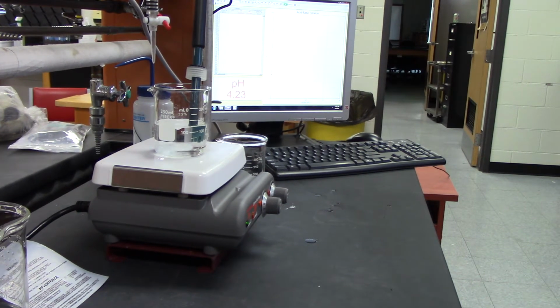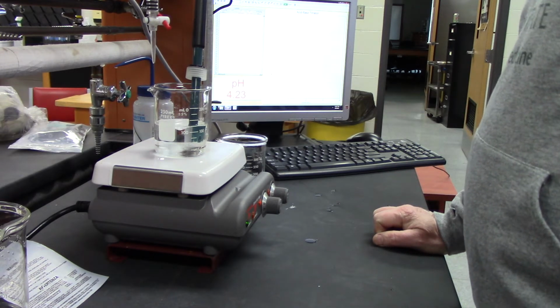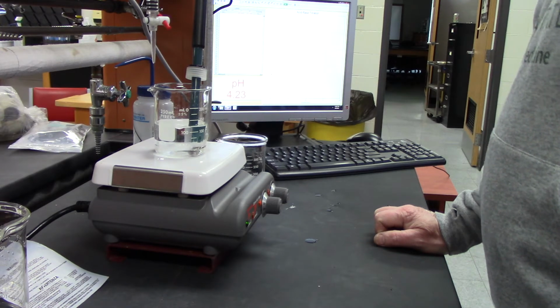Right. So the next thing I want to do is make sure I get my starting point of my sodium hydroxide.